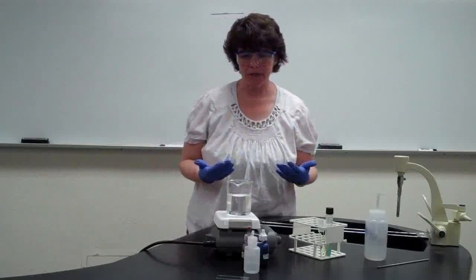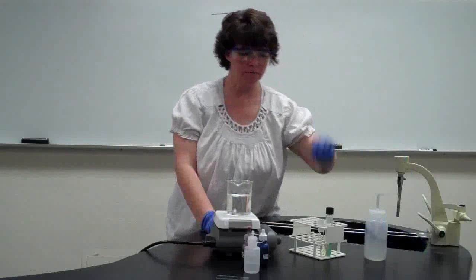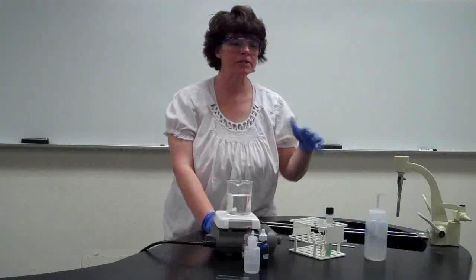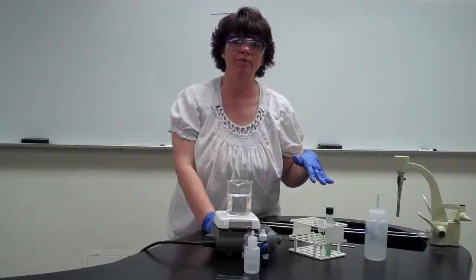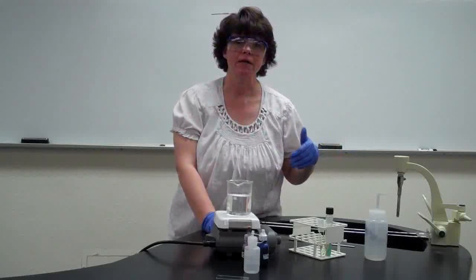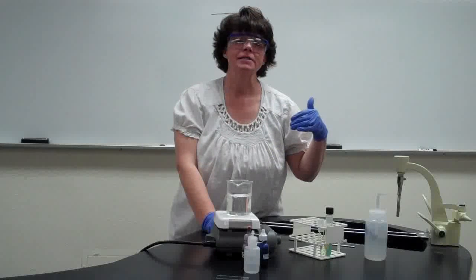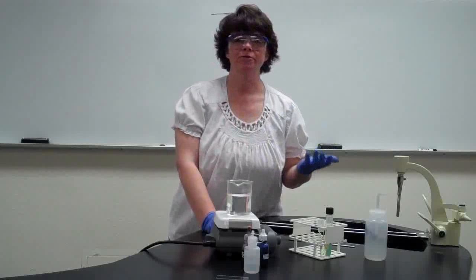So the supplies that we're going to need are going to be our slides, our inoculating loop like with all the other ones. Now I don't have a Bunsen burner out here because I'm not going to demonstrate how to fix your smear. You already did that in your simple stains, and then you also do that in the gram stain. So remember what I said the first video, is that unless the procedure tells you not to, you're going to be fixing the smear.